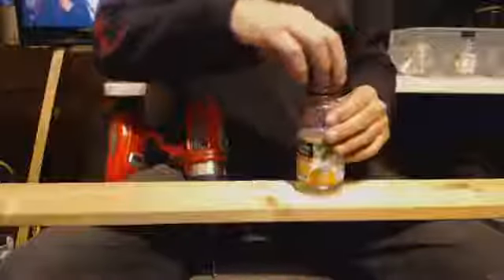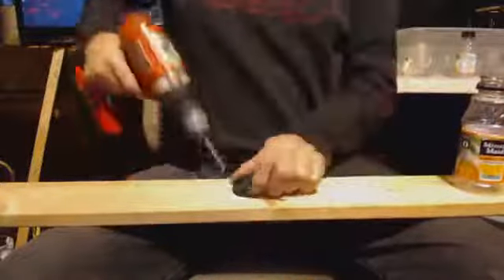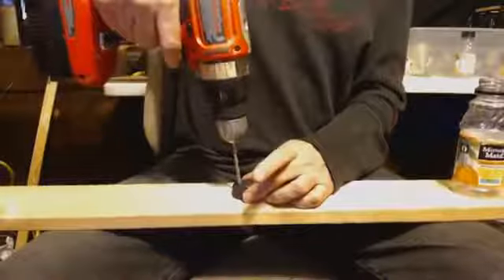Well, let's get to building it. First thing you'll need is a bottle, any kind of plastic bottle that has a cap you can drill holes into. Basically, my hose has an OD, or outside diameter, of 1/2 inch, so I want two 1/2-inch holes in there. First, I'm going to start out with a 3/16 drill bit just to get the hole started. Then I'm going to move on to a 1/2 inch diameter drill bit, and that way it'll fit nice and snug with the tubing inside there.